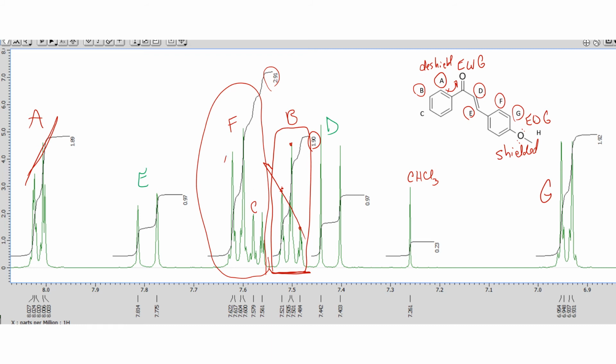And then on F here, F is leaning that way, and G, so it's leaning towards G. Okay, and remember we've got D and E leaning towards each other. It's just a little something that is a finer thing on the NMR that you can look for, that lean. Okay.